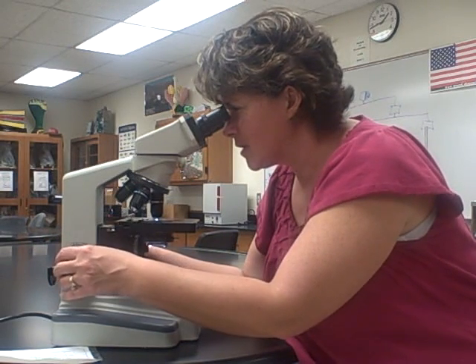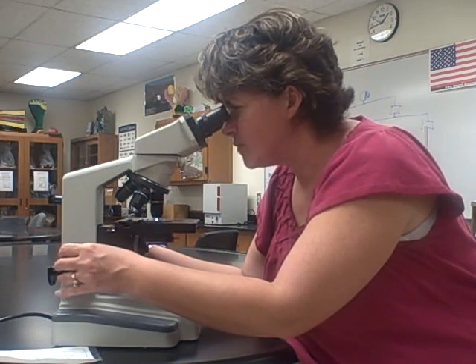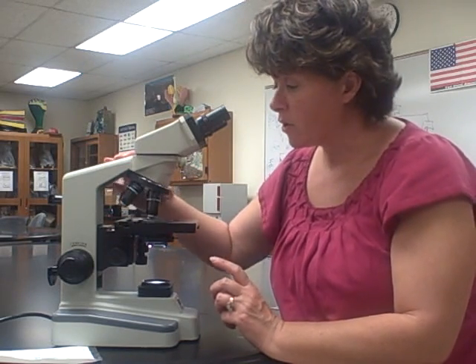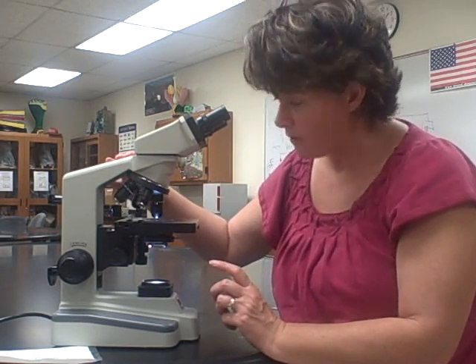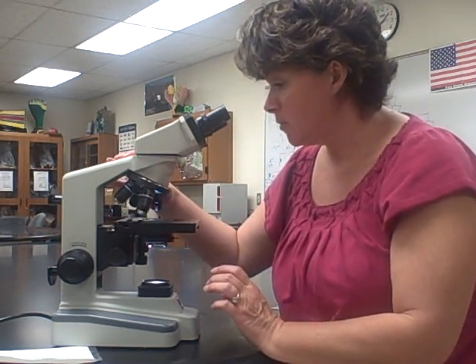If it doesn't come into focus, come back a little bit. If you find that you're having to focus way too much, you need to start over — but we can't go back to the 40x because we can't get oil on it. We go back to the 10x, find the specimen again, then go back to the 100x. That's why I stress making sure you have it centered and in focus on the 40x before going to the 100x.